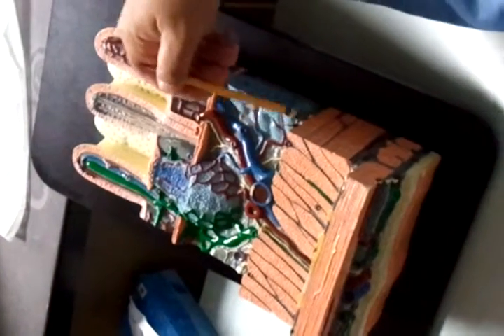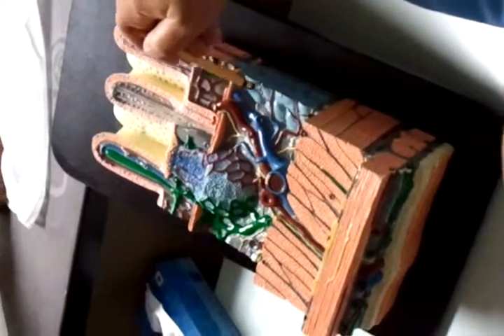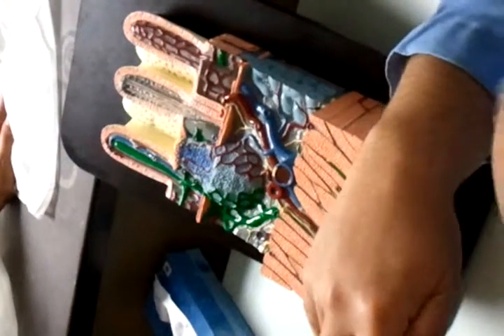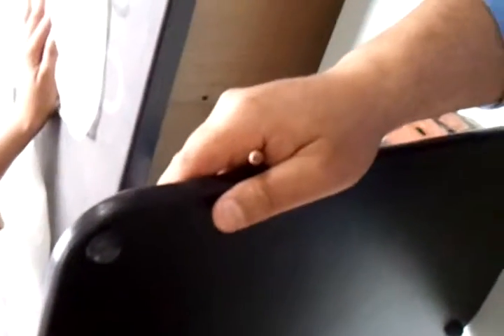And then we have here the submucosal glands, which, since we're in the duodenum, have other names: duodenal glands, mucus secreting glands, or Brunner's. And you can see them in a cross section, and that will help you to see that on the slide. On the slide, you can see cross section of the submucous glands, which will be very characteristic for the duodenal slide.